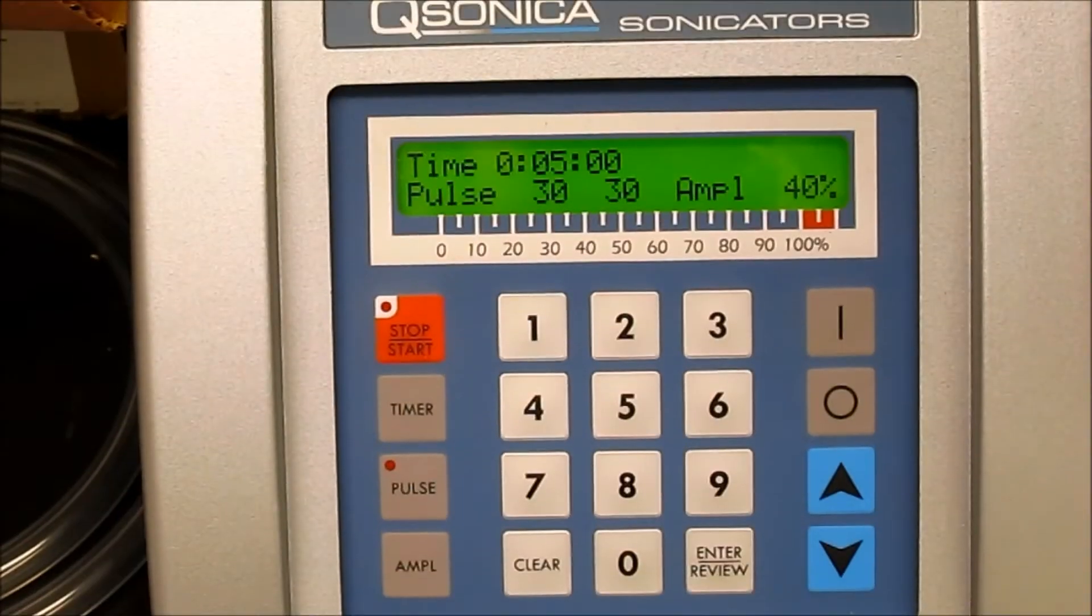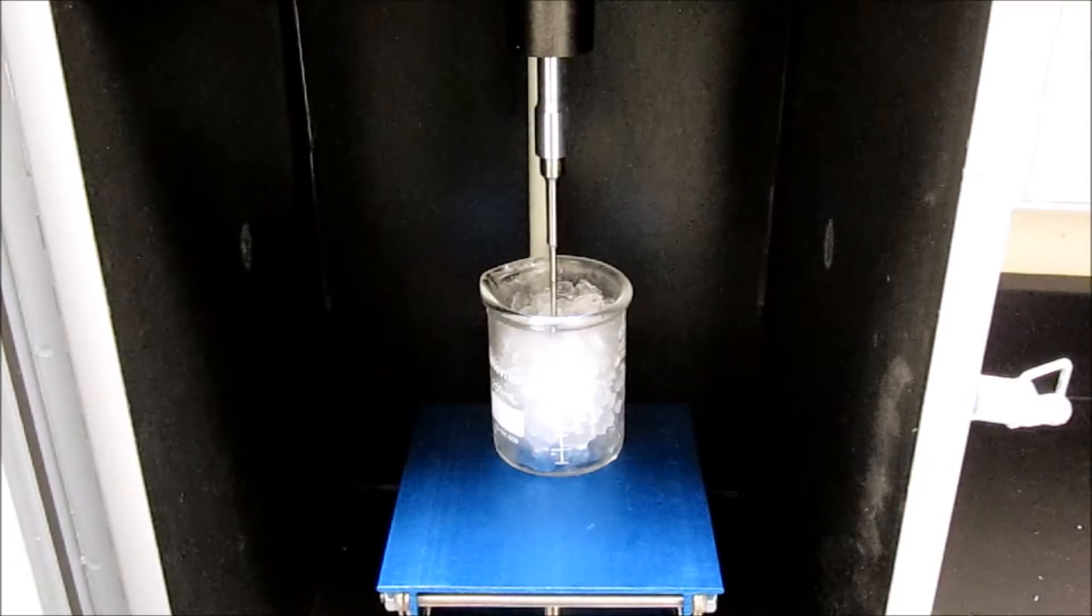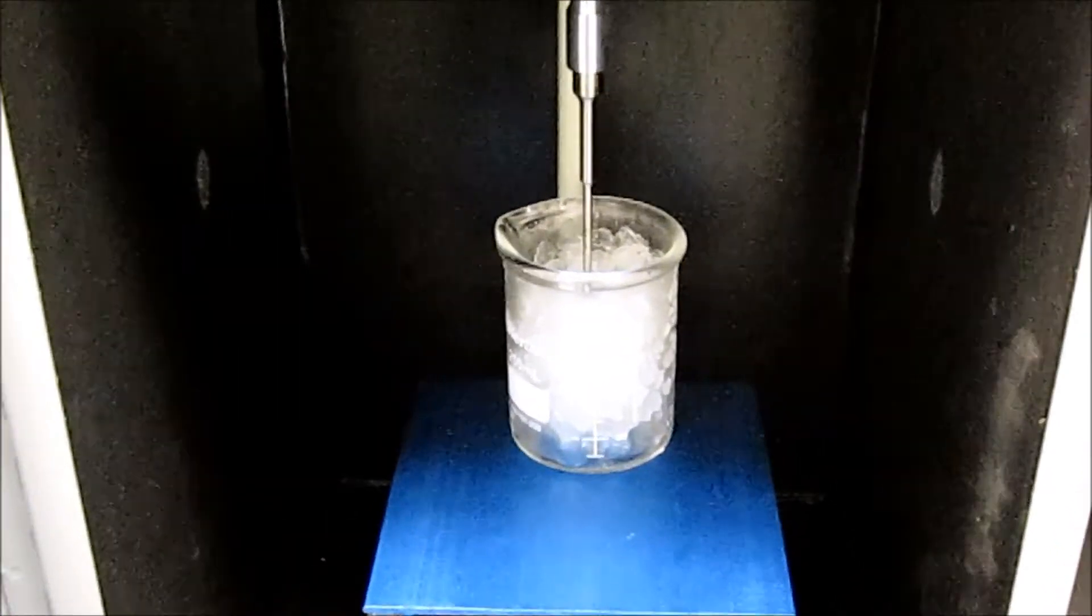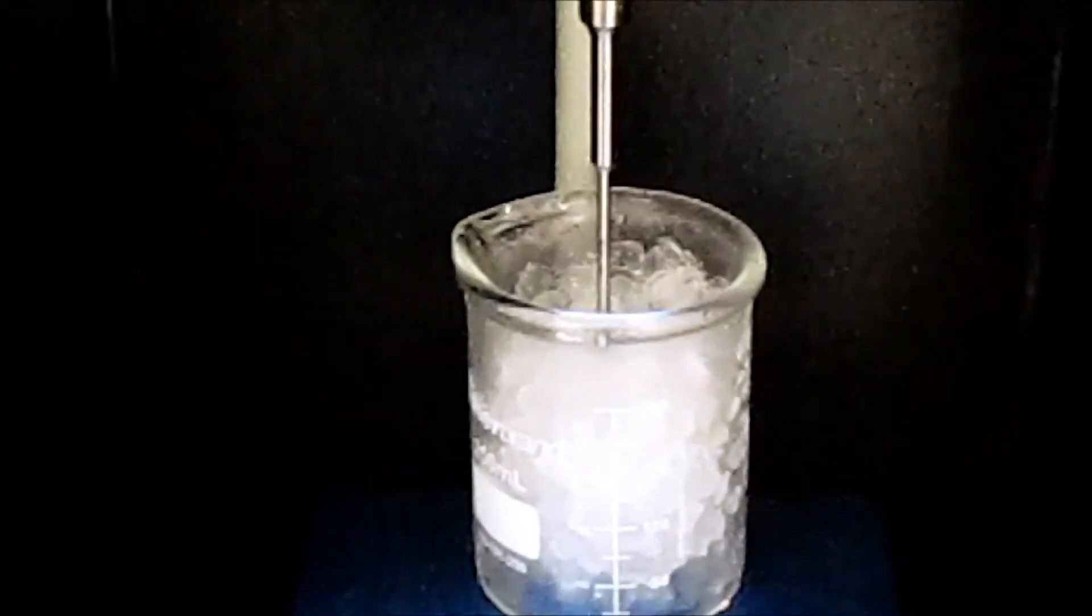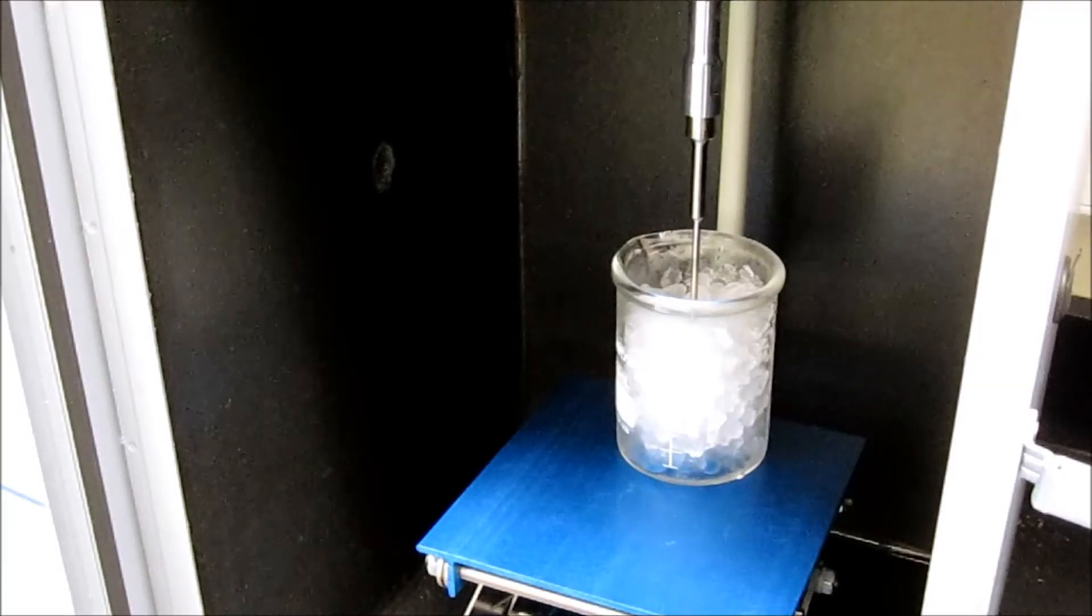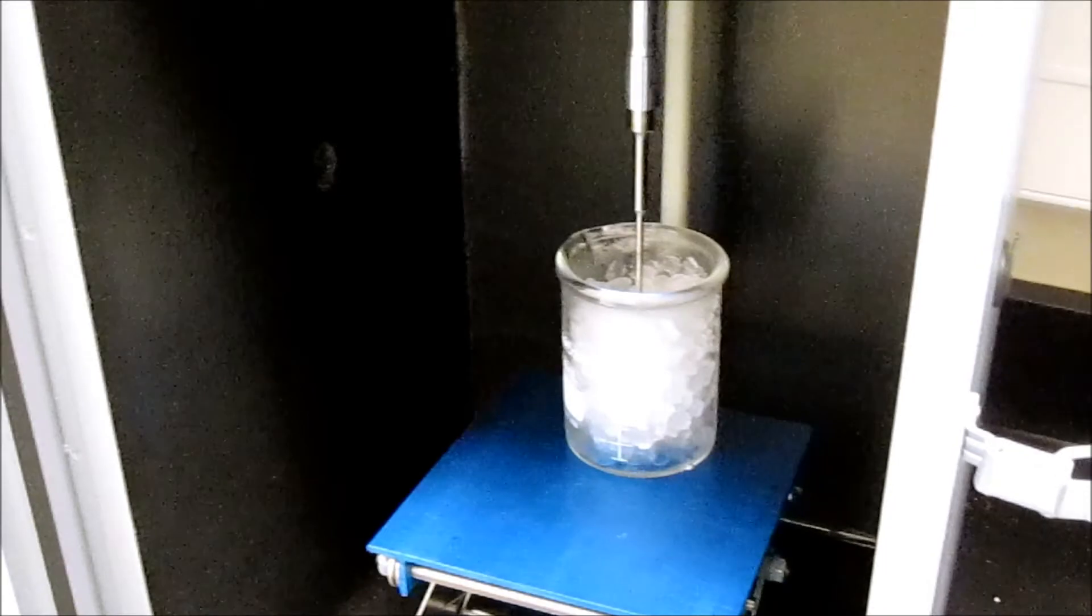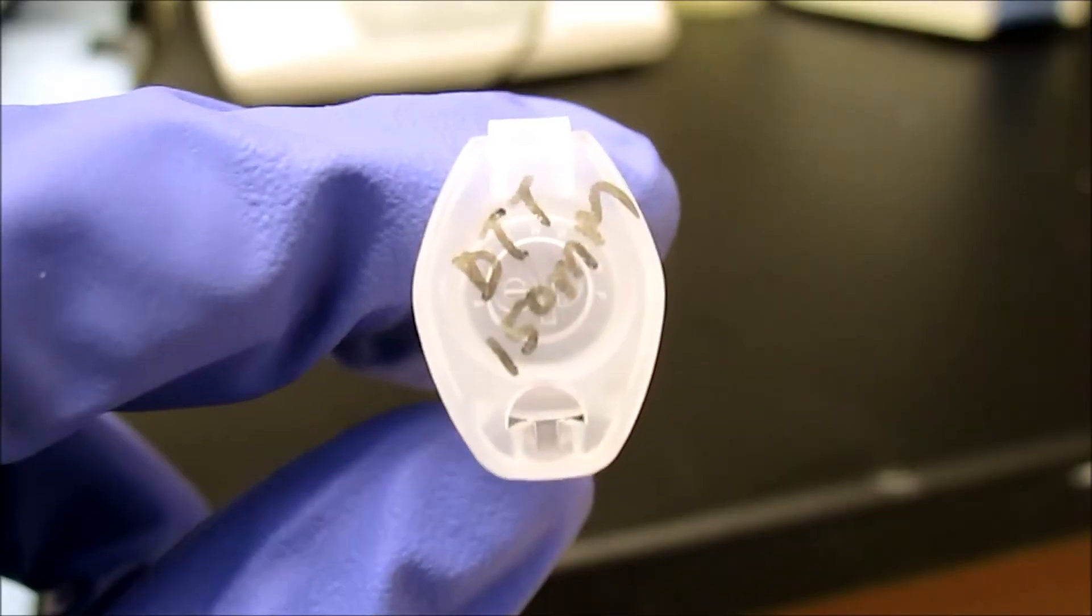Next, the liposomes must be sonicated on ice for 5 minutes at 40% amplitude, switching from on to off every 30 seconds to prevent overheating. Sonication subjects the liposomes to ultrasonic waves that break the liposomes into smaller particles.